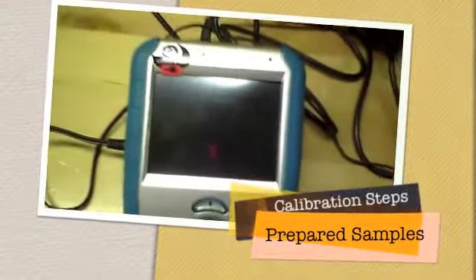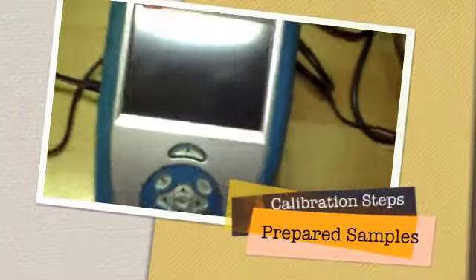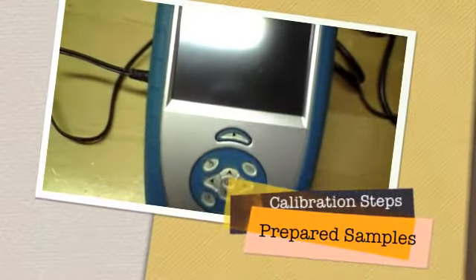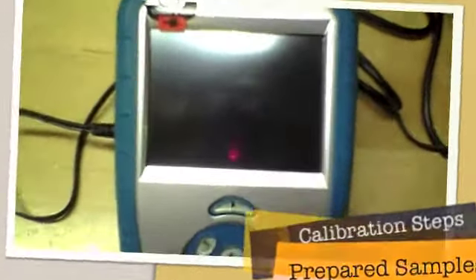Good morning again. This tool that you're going to have the opportunity to use is called a Vernier Lab Quest. It's a kind of handheld computer thing that allows you to do all sorts of testing, and the one that you're going to be doing today is just one of many that it can do. It can test the temperature. I think we used it in science class before, and it can also test pH. It can test water conductivity. It can do a lot of things, but let me just show you how this particular test works.